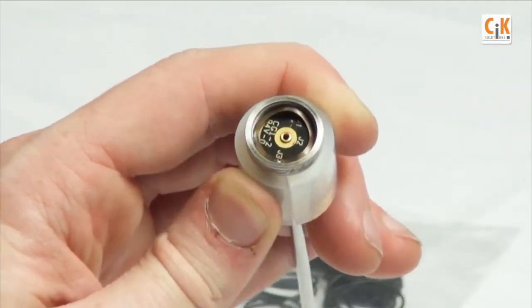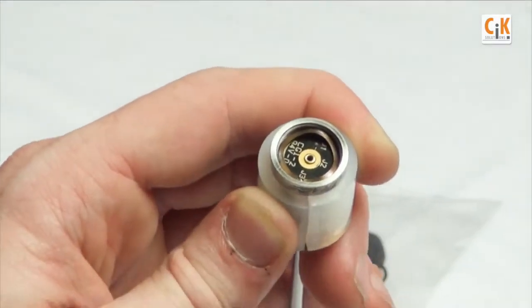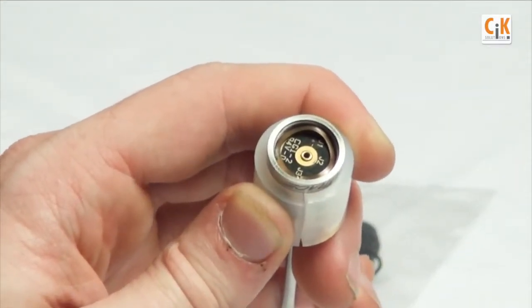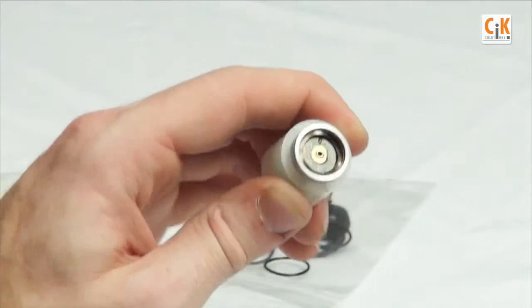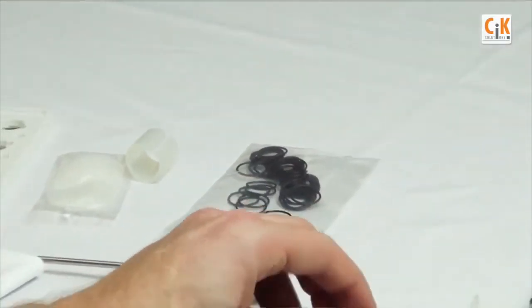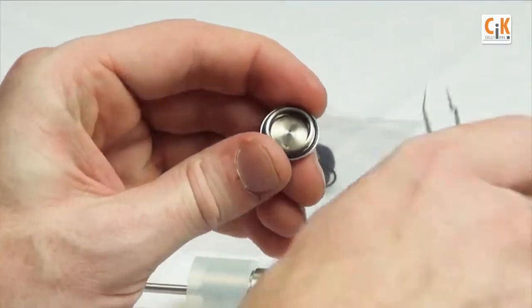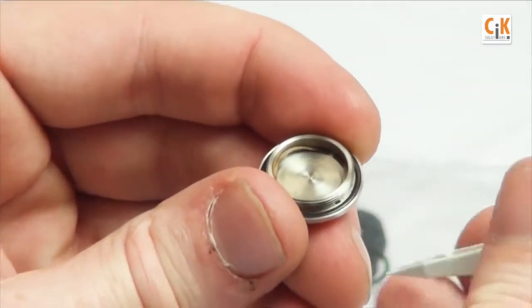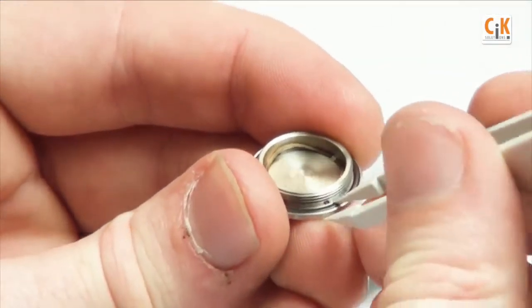Finally remove and discard the o-ring. Set the logger to the side, remove and discard the o-ring to be replaced using the pick tool provided.